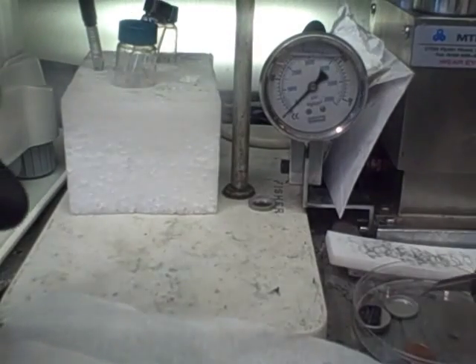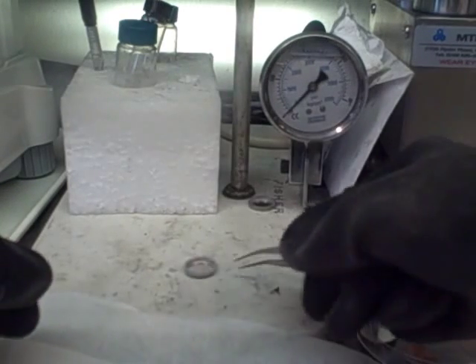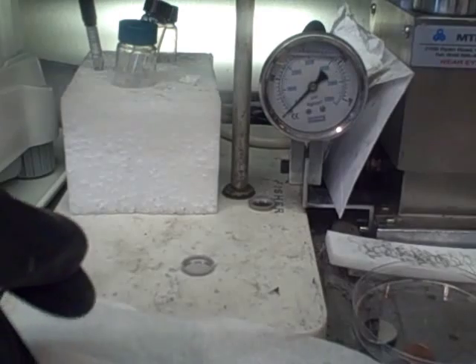Because lithium is highly reactive to water and corrodes in oxygen, we assemble our cells in a glove box that minimizes these reactants. The first component in assembling our cell is the bottom container, which has an insulation ring that will seal our cell from moisture and air.